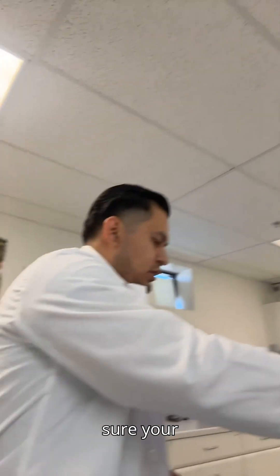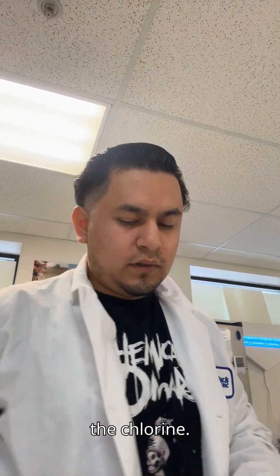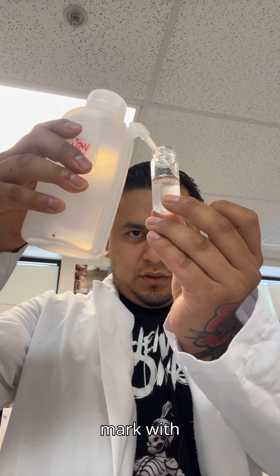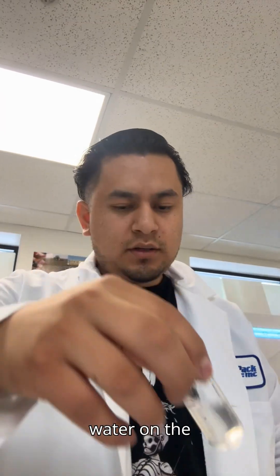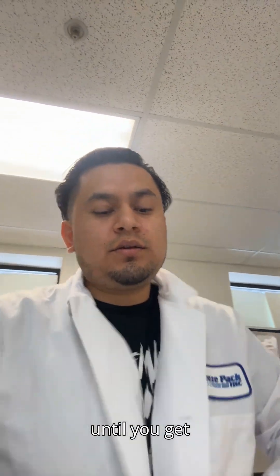Make sure your syringe is all clean. You're going to add your two and a half milliliters of the chlorine, then fill the rest to the 10 milliliter mark with regular water. Wipe off any of the excess water on the outside. Match the diamond with the triangle, and calibrate until you get a zero.